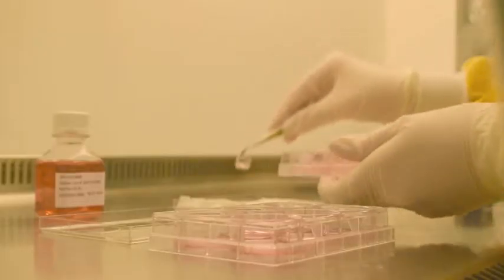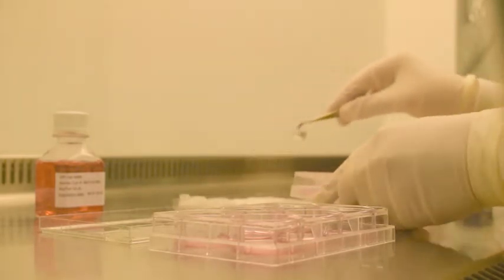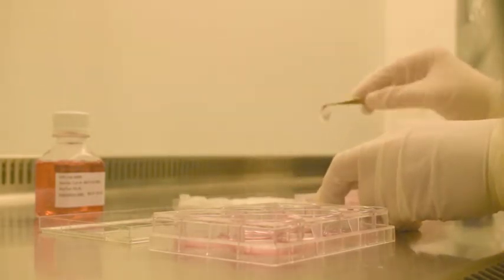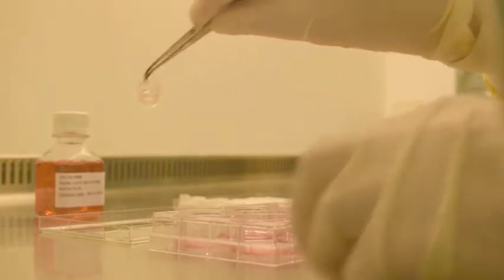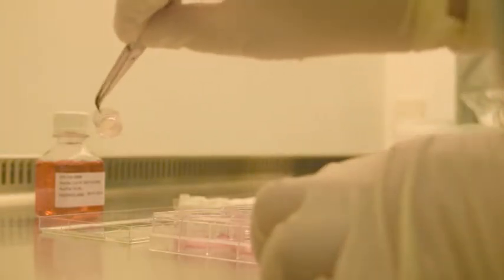Using tweezers or forceps, each tissue is removed from the agar via a twisting motion. Excess agar is dabbed off using sterile gauze.